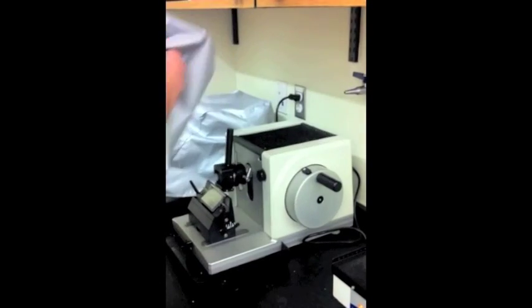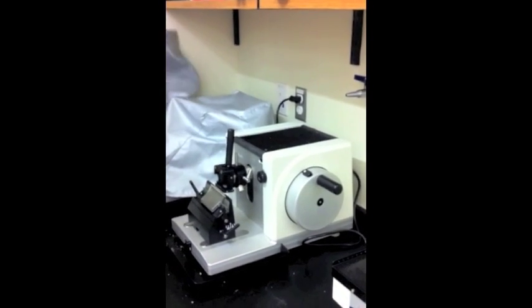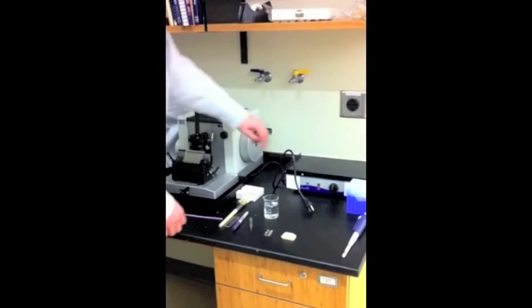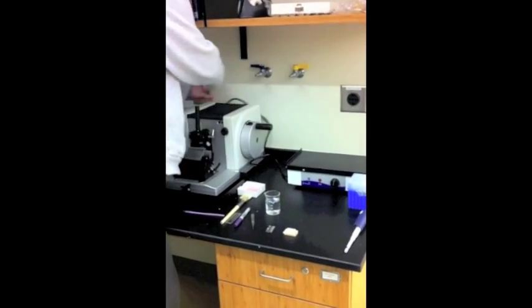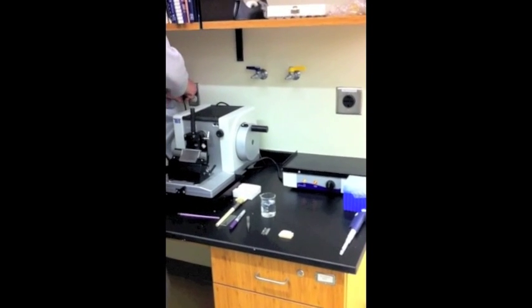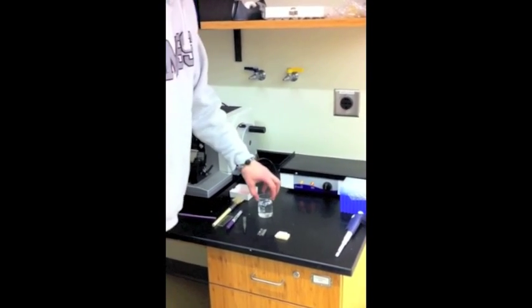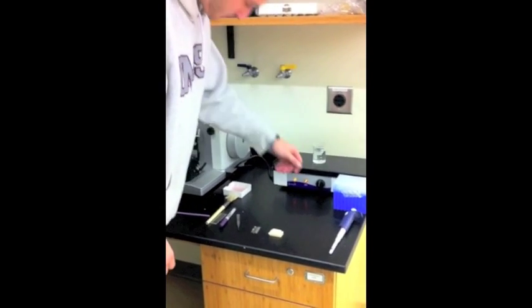Uncover the microtome. Plug in the slide warmer and adjust the dial to the middle position. Place a beaker of water on the slide warmer with a transfer pipette within reach.